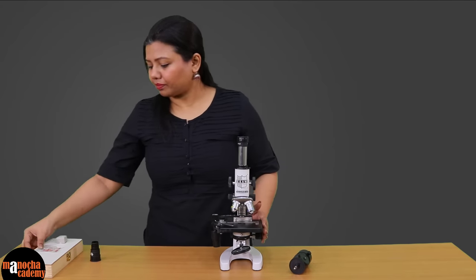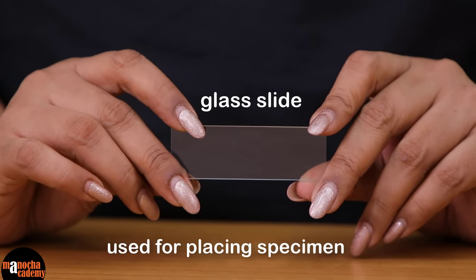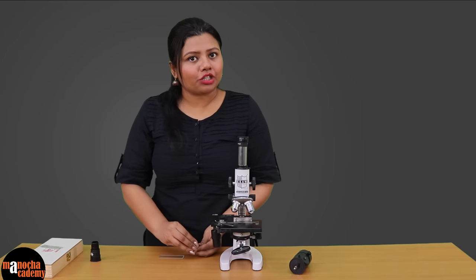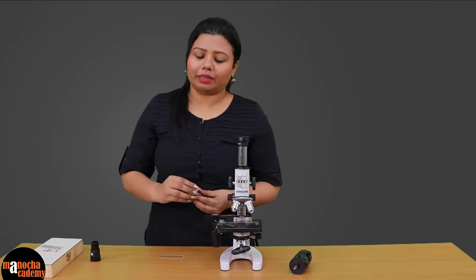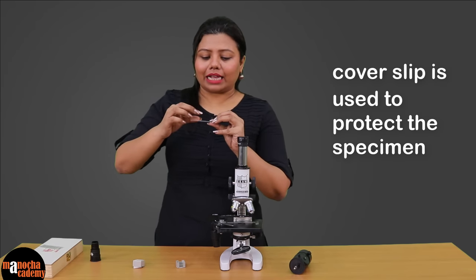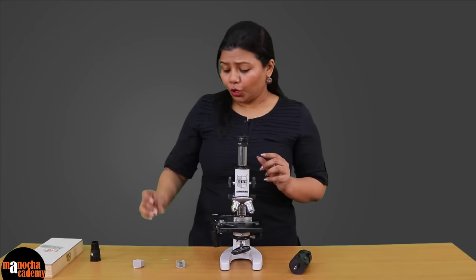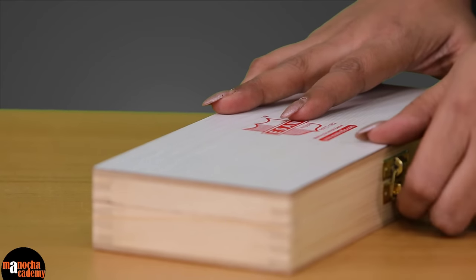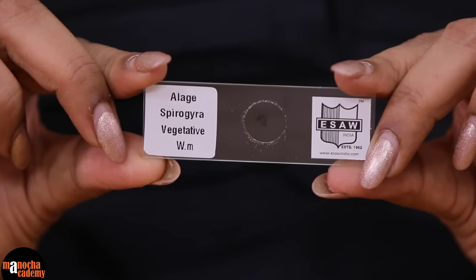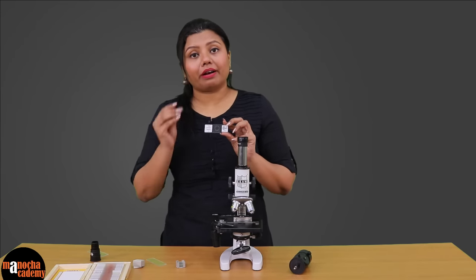We will show you a slide. This is a glass slide on which generally we put a specimen to observe under the microscope. So that your specimen does not dry out or get damaged, we usually cover it with a cover slip — an absolutely fine piece of glass used to cover and protect the specimen. This slide is of the algae spirogyra. As you can see, there is a cover slip here; in this case the cover slip is round, but you may also have square cover slips.